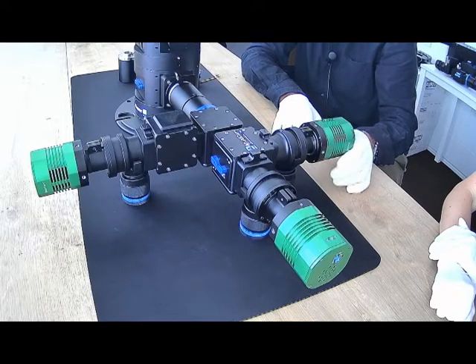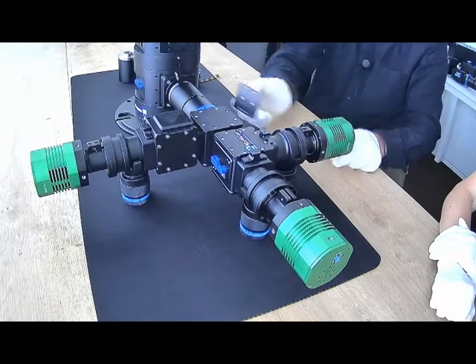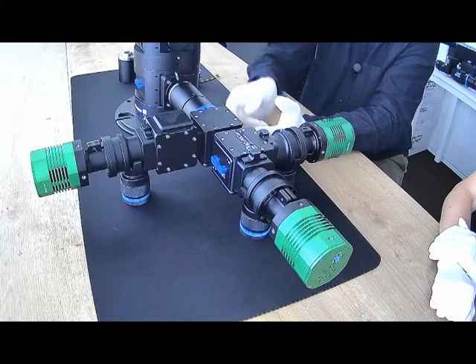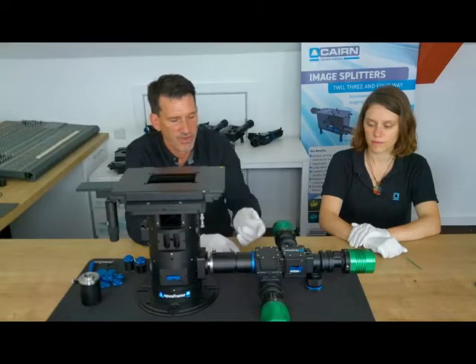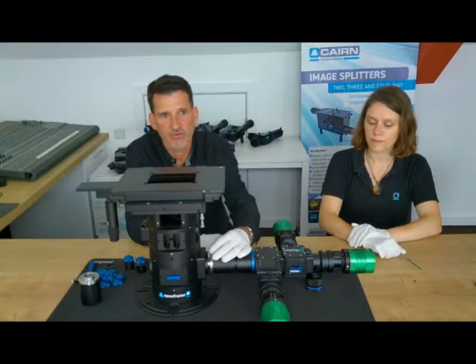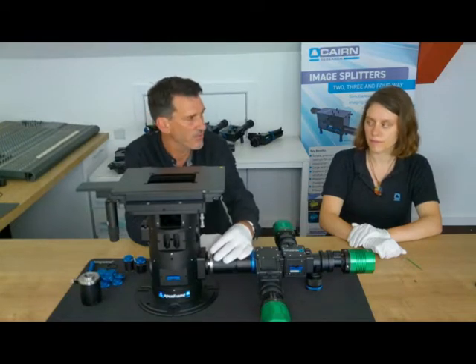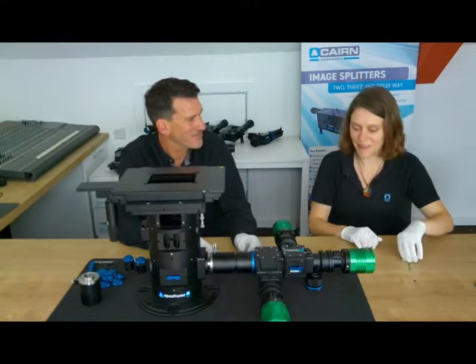So we'll be adding to this camera range in due course. Watch this space. As with the twin cam, we have individual cubes, we have XY alignment, very precise pixel alignment of the different channels. We can insert filters, we can have filters in the filter cube, and we can support fields of view up to 22, at a pinch 25mm diagonal. Anything to add, Russ? No, I think you've got it well covered there.